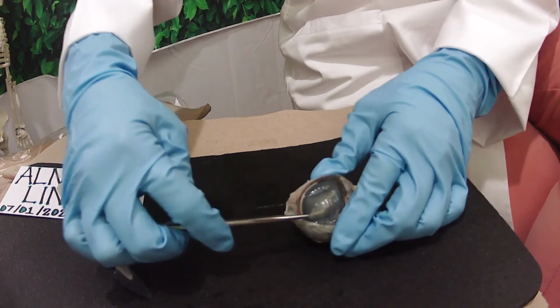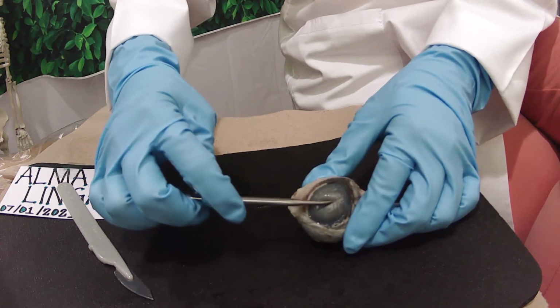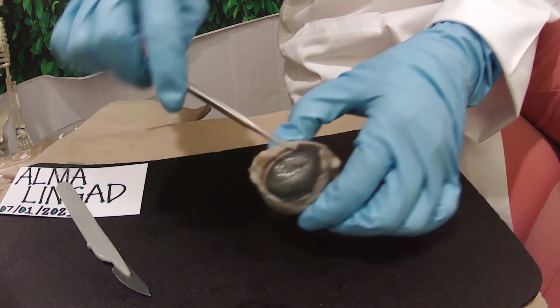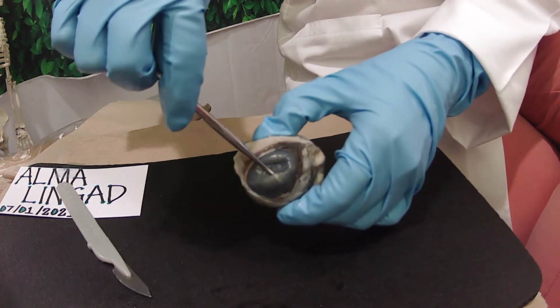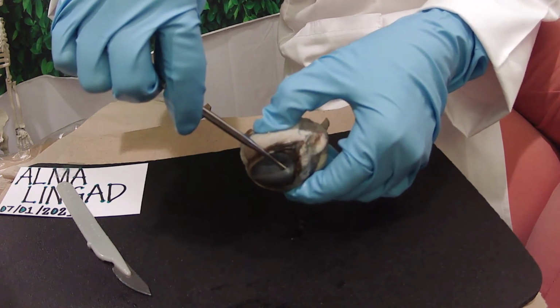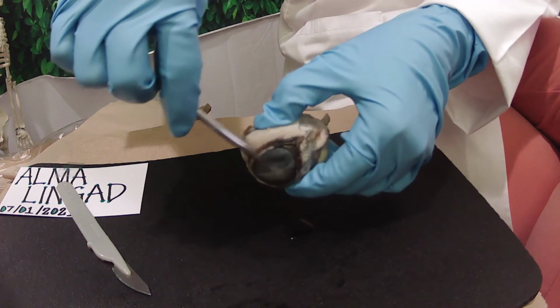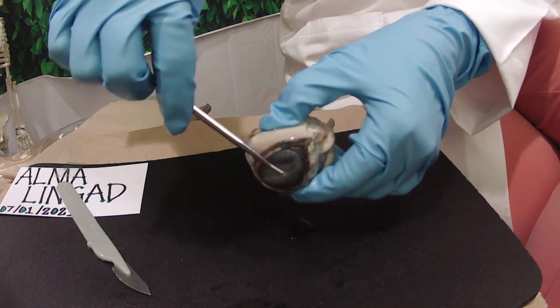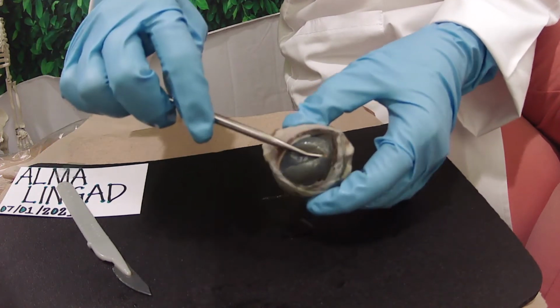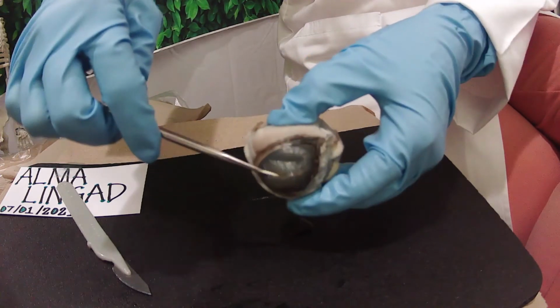Oh, there it is, the liquid. It is the space between the cornea and lens. Yeah, that's the aqueous liquid. It is filled with a watery fluid, the anterior eye cavity. The aqueous humor is filled with watery fluid, like I said, and we'll go from there.